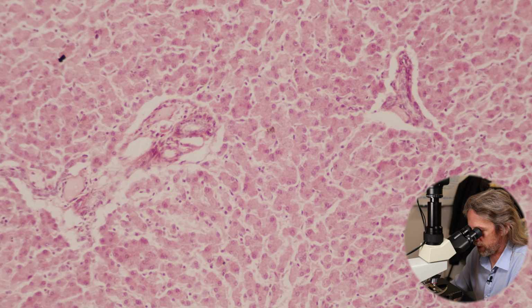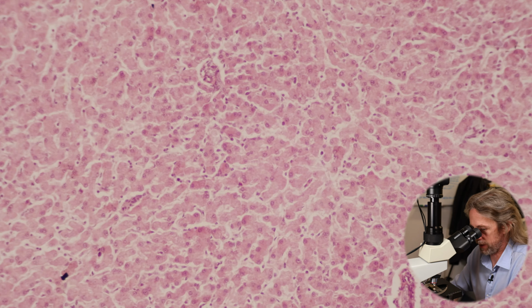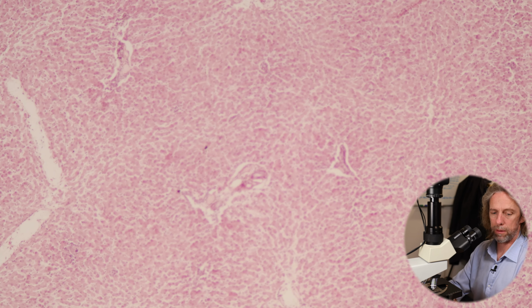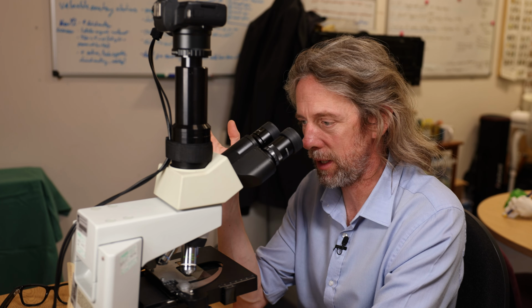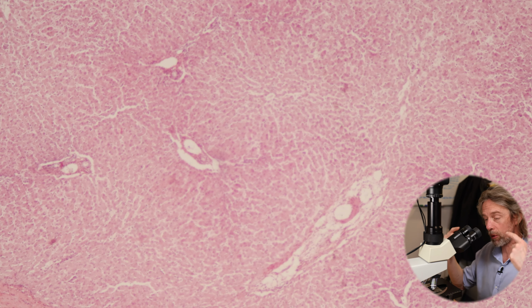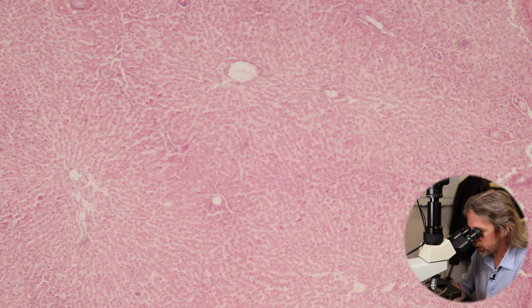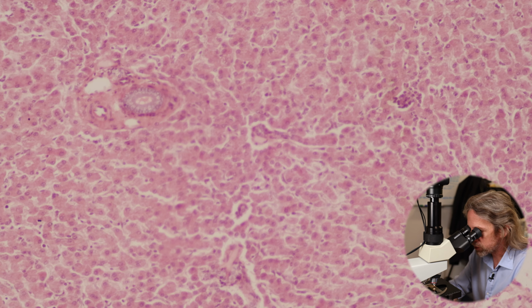So yeah, like I say, there's a triangle between those two portal triads and that central vein. And if you take that triangle and add it onto that triangle, you've got a diamond, and that's your hepatic acinus. Those layouts can be confusing because they can be difficult to see. But let's go find a really good portal triad. If you can identify a portal triad, and find a central vein, you'll see all those sinusoids with the blood in it running towards them, and then you can see what's going on in the liver. There's a nice one. Then you understand microscopic liver anatomy.